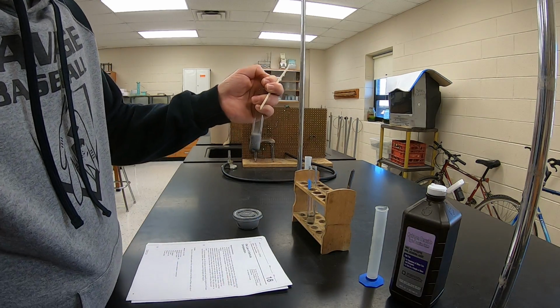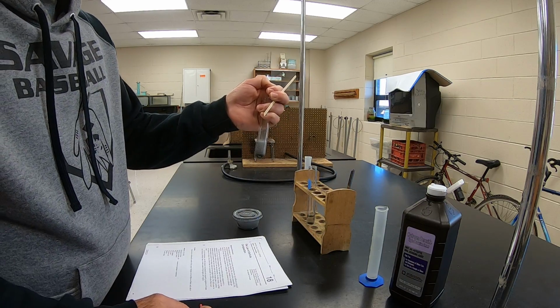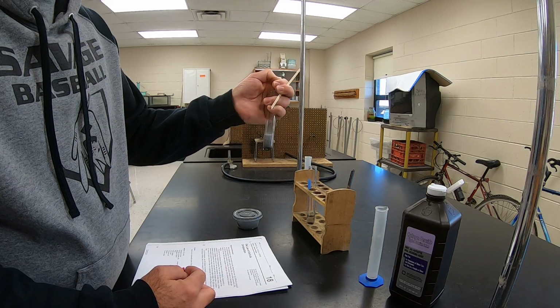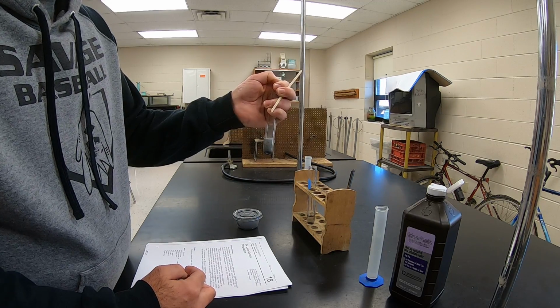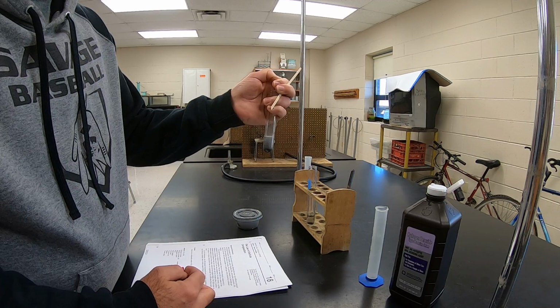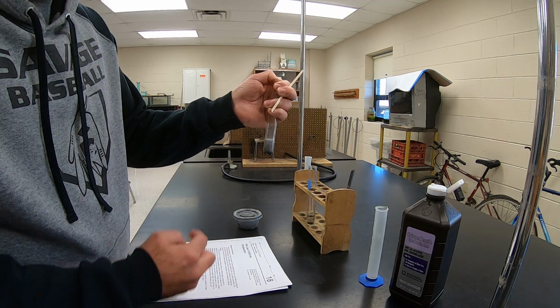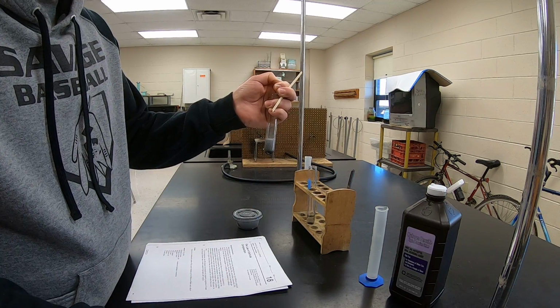If it would be hydrogen gas, it is very explosive, and if we would put a burning wood splint in there, it'd make a popping sound as there's a mini explosion taking place. If it was carbon dioxide gas, it would put out a flame. Okay, because carbon dioxide is not flammable at all. Another gas that we'll deal with is oxygen gas.